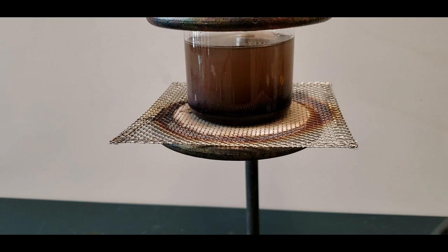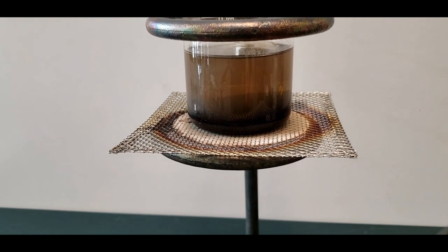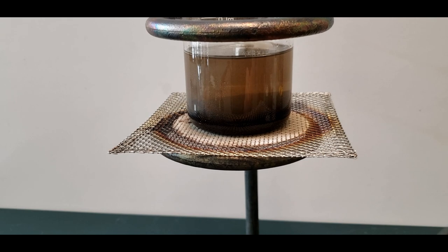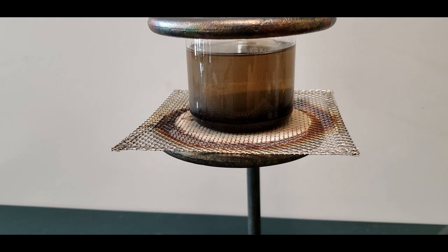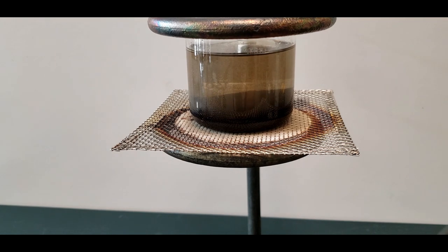I found that I had to add in quite a bit of acetic acid, taking a lot more than I thought it would. But I think at last the color is gone. What you see there is just the silt of the copper oxide, just a little, because of all what I've been putting in there, it's just been kicking it up. But you can see it's falling back down to the bottom. The solution, aside from this gray look to it, it's colorless. The pink is gone. So the pH must be approximately seven. At least it's not basic anymore.